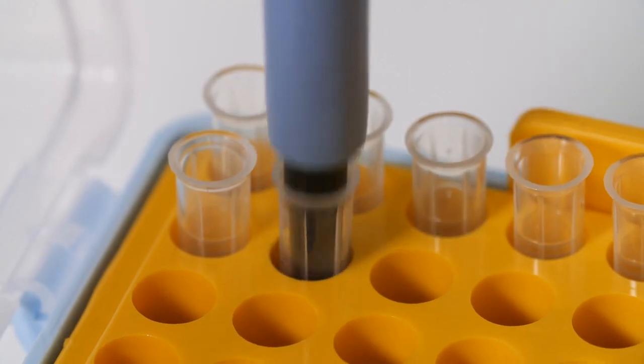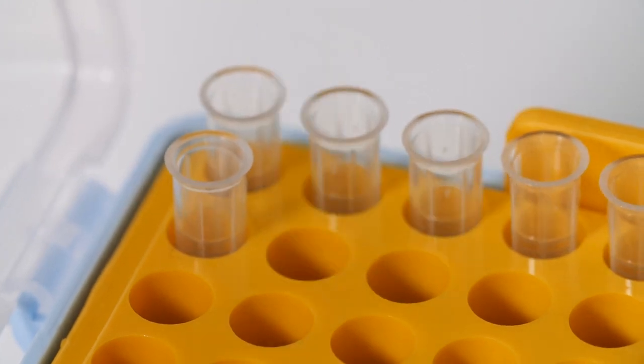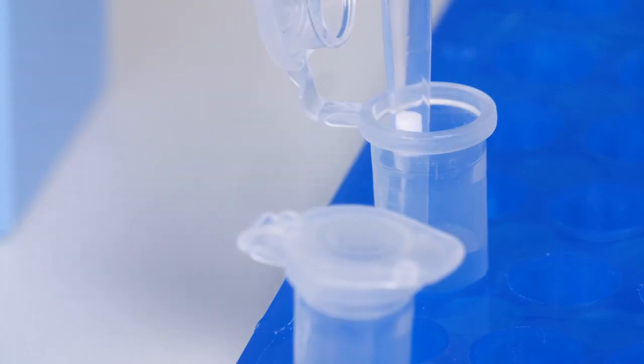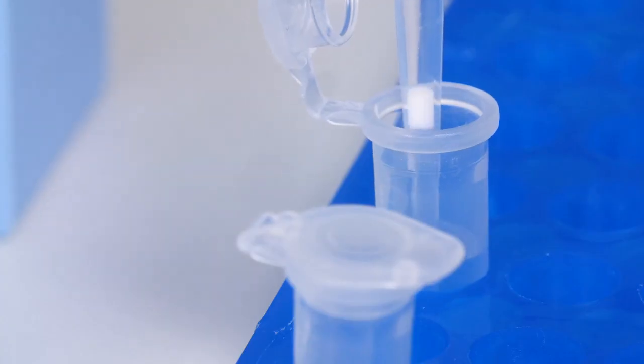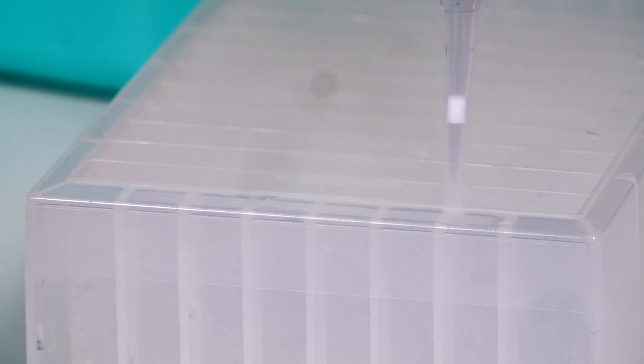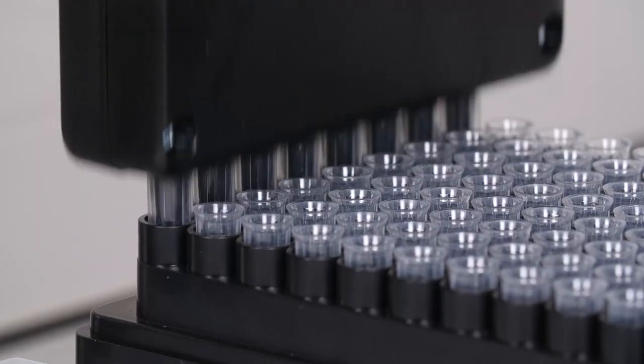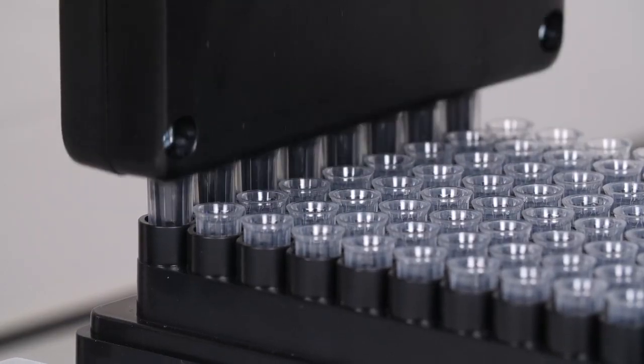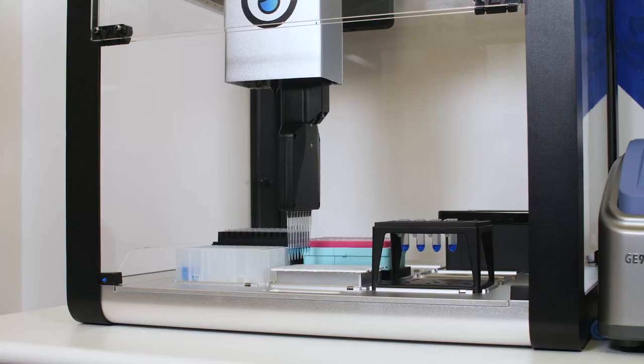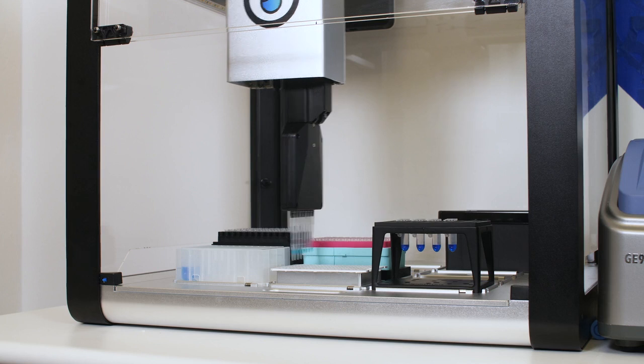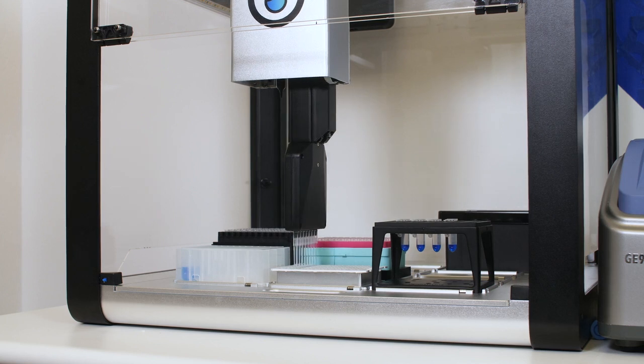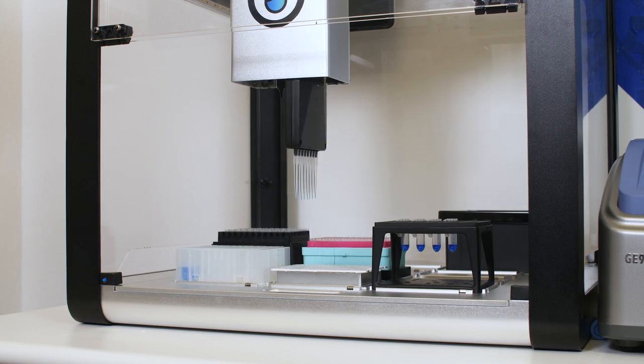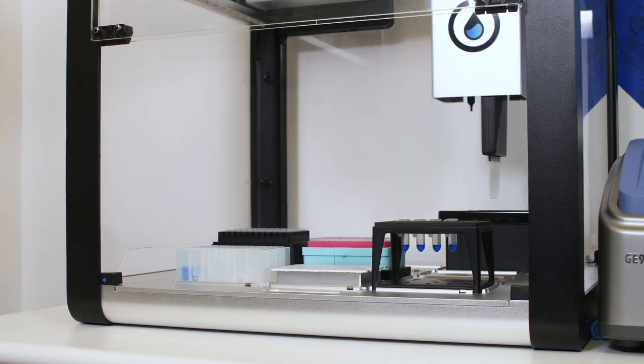The second step is to manually prepare a SuperMasterMix that combines your primers and PCR MasterMix into one reservoir. This allows the robot to do a bulk dispense step with the SuperMasterMix into every well, which prevents reagent waste and makes the run more efficient.